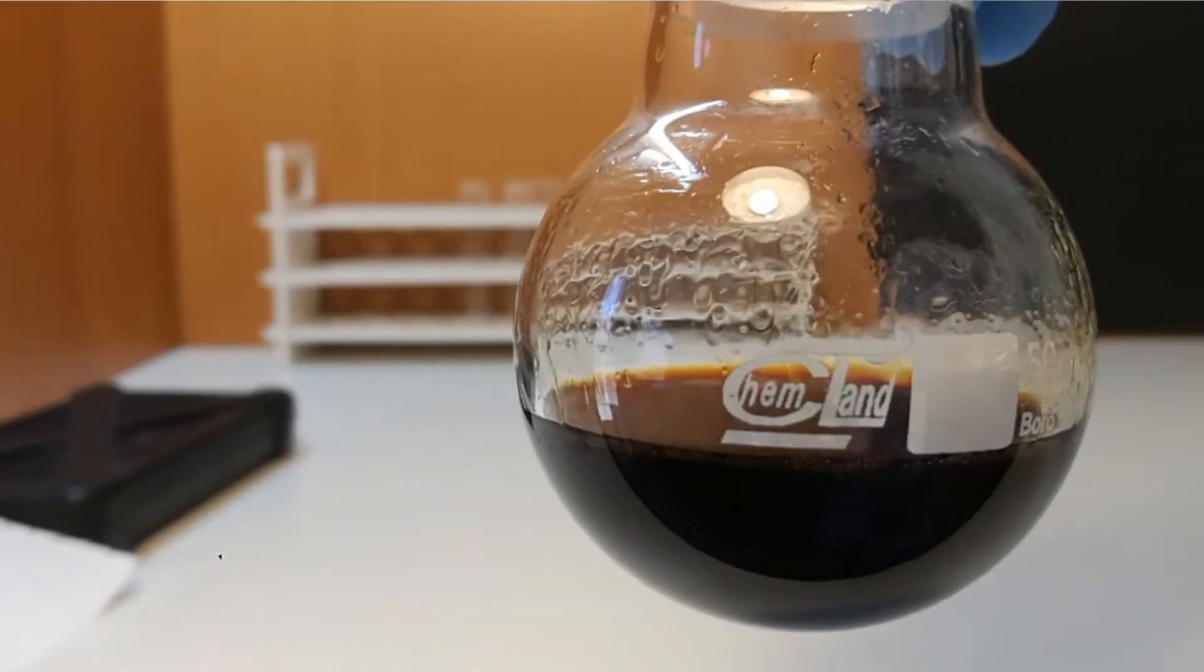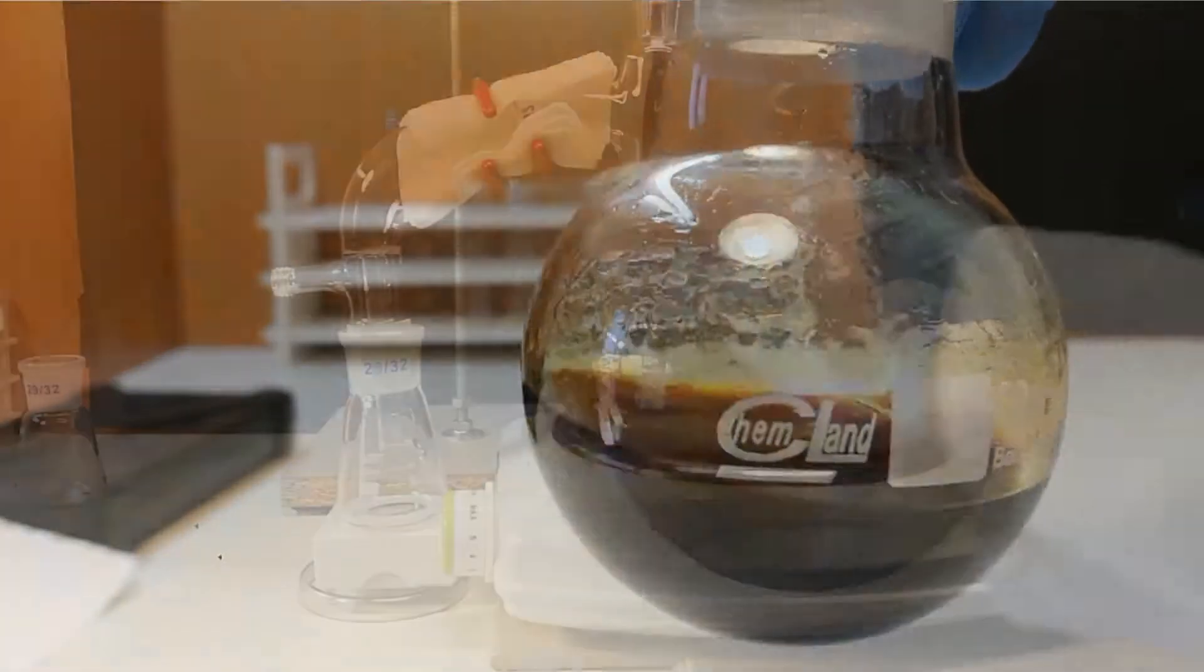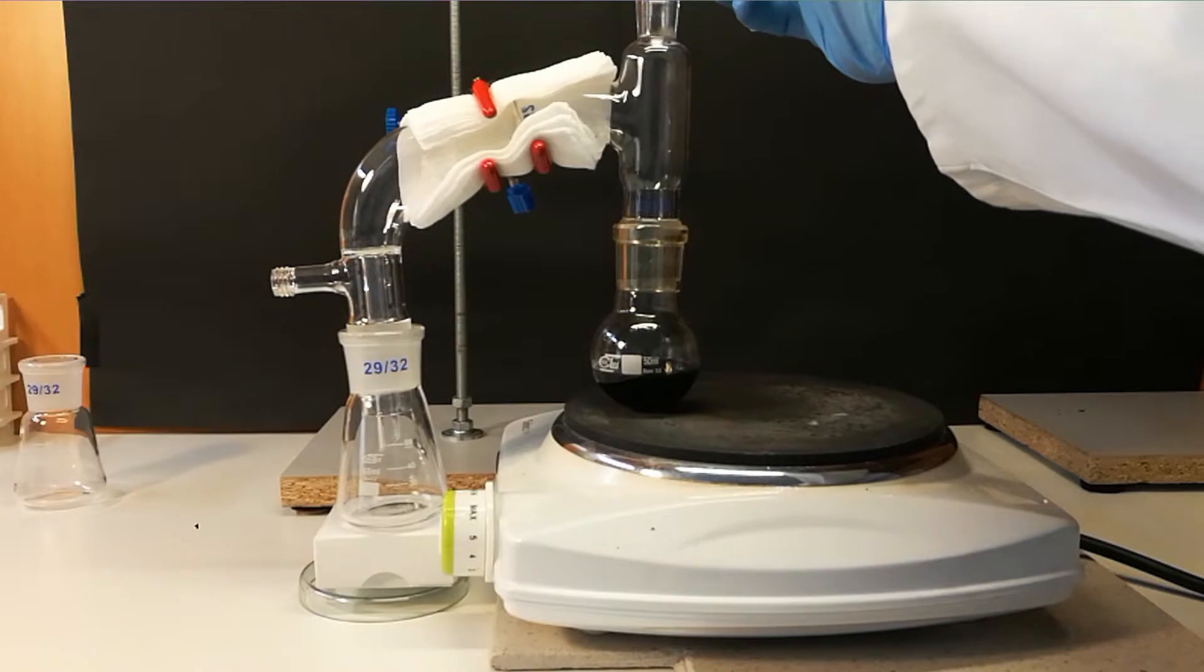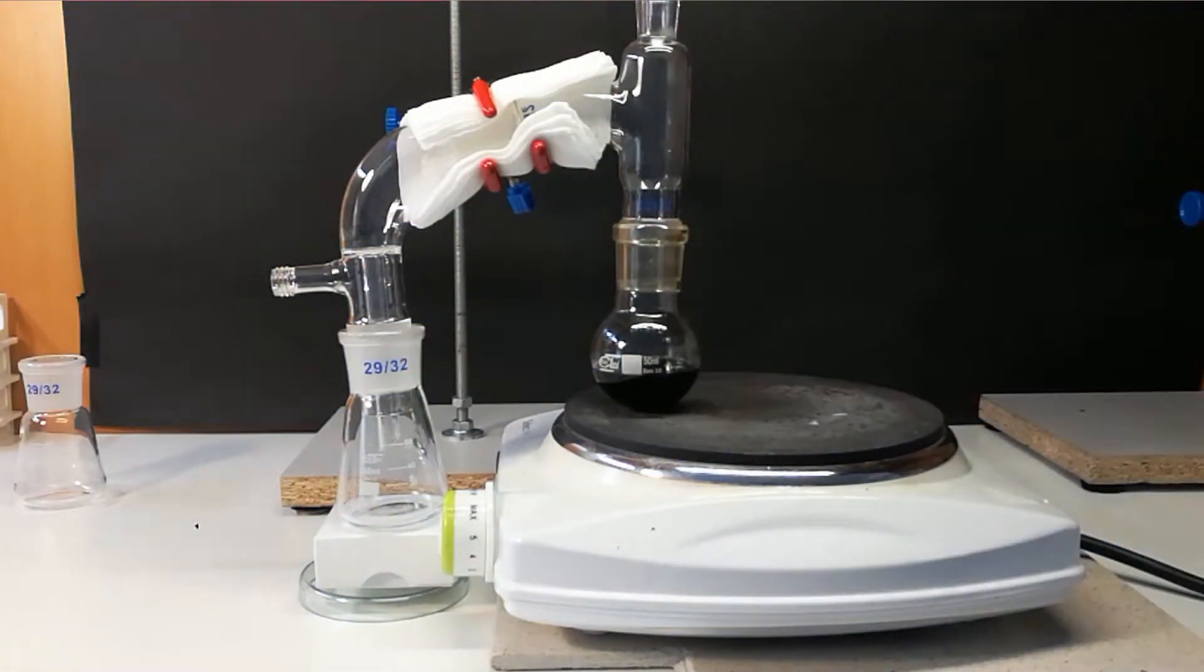This is crude product, we need to distill it. Here is short path distillation apparatus. Add some boiling stones and we are ready to go.